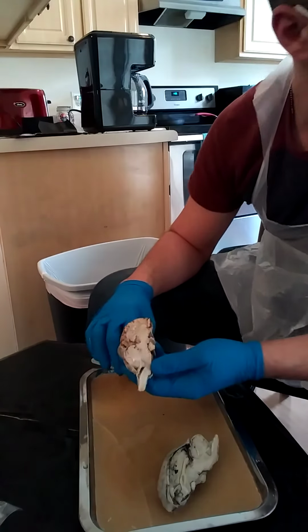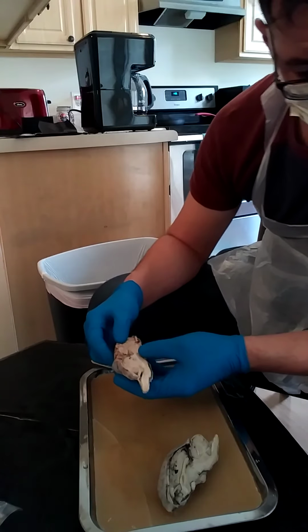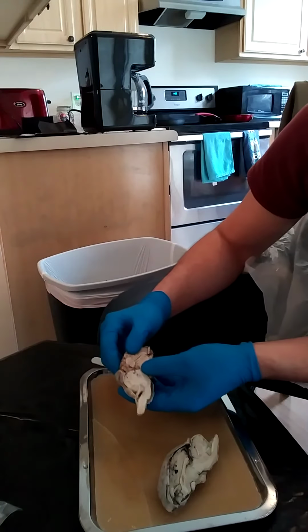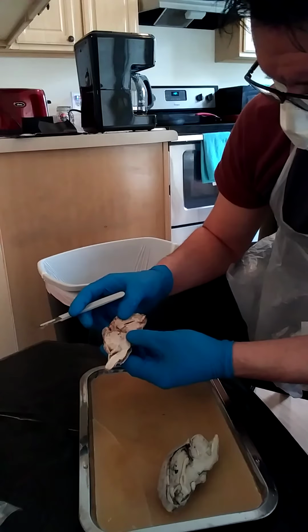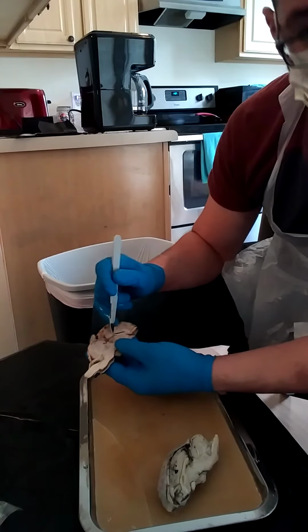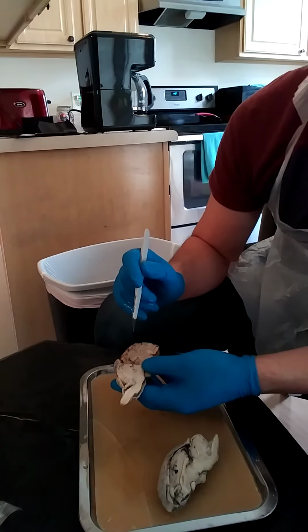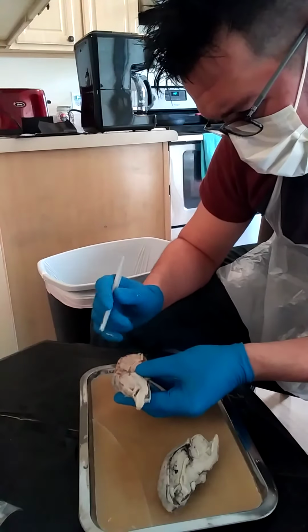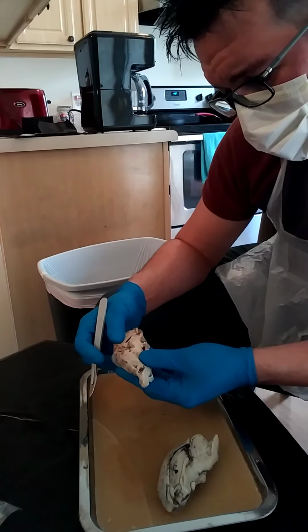Now, to begin. The corpus callosum is, if I'm not mistaken, this space right here, whereas the lateral ventricles are, where is it? Yeah.